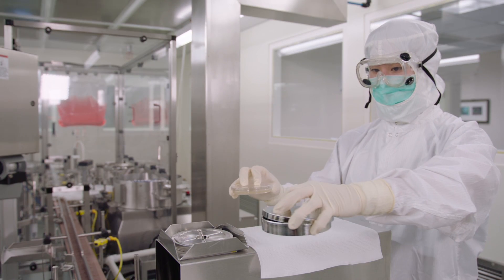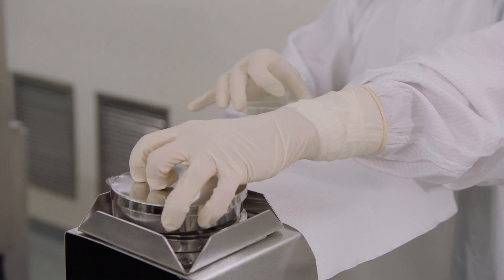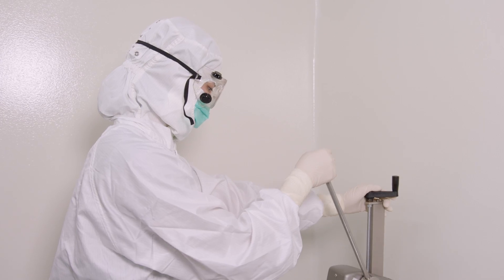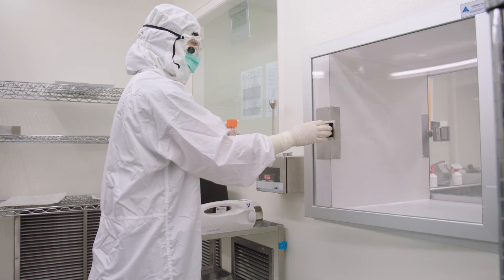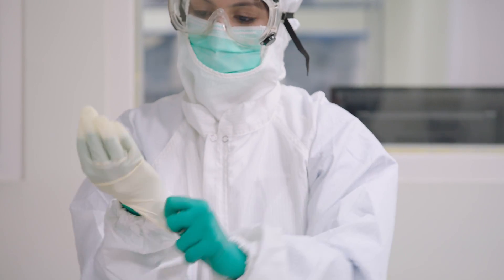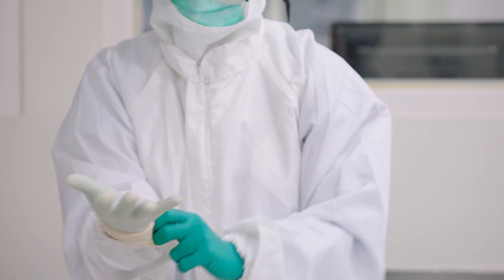While many disposable gloves offer the comfort and tactile sensitivity that workers want, their thin design may not stand up in high-risk applications. The risk of tears, punctures, or pinholes leave workers and their environments at risk. When a thicker glove is not practical, the best way to increase your level of protection is to wear two pairs of disposable gloves. This is called double donning.